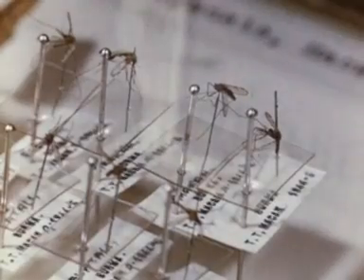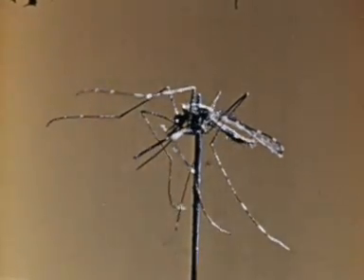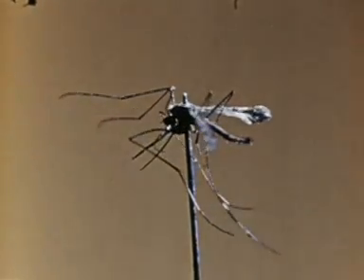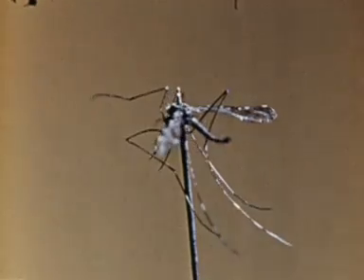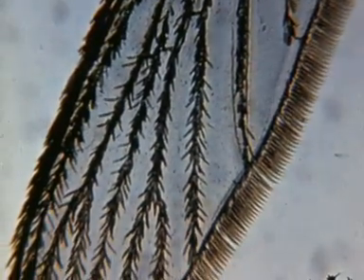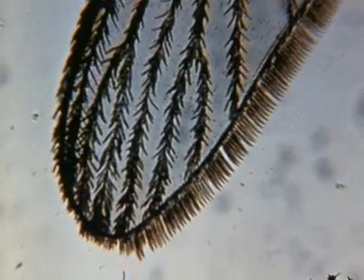The pin is always placed so that the insect can be examined from any angle, and it should be inserted so that it doesn't damage the important structures. It is important too not to touch the specimens with the hands, because many insects, including the mosquitoes, are covered with fine scales. These are easily rubbed off, the specimen is spoiled and identification is made more difficult.